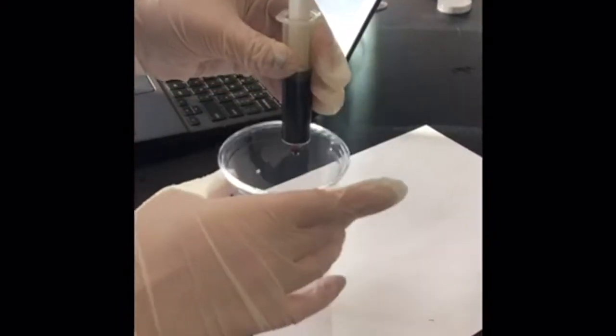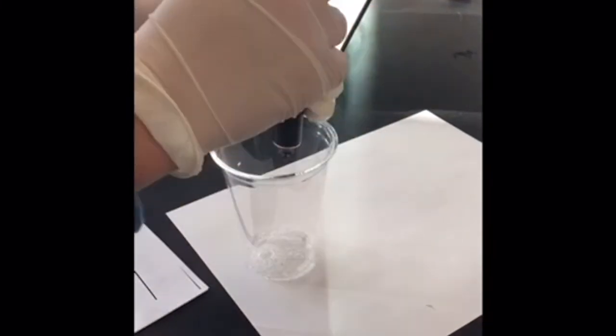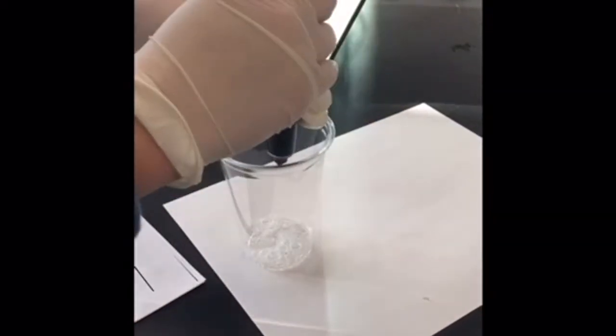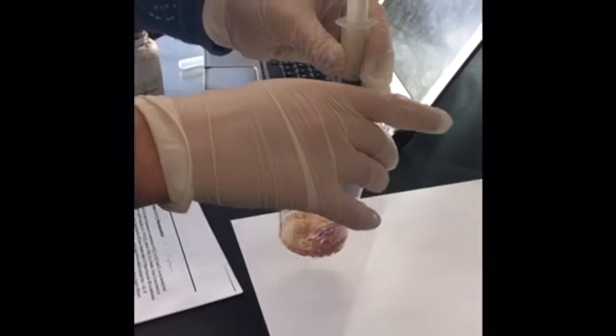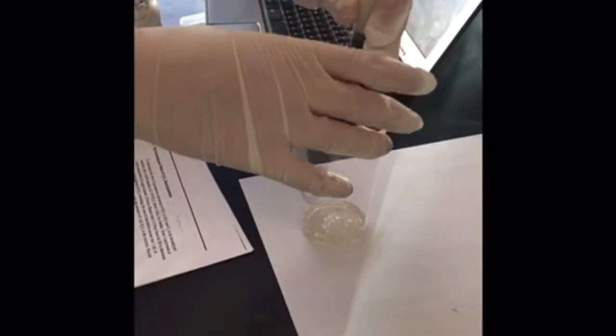We discovered that the amount of hydrogen peroxide spontaneously decomposed was 3 milliliters, and the percentage of hydrogen peroxide that was spontaneously decomposed in 24 hours was 14.29%. This means that since the hydrogen peroxide was left overnight, the rate of the uncatalyzed reaction was 14.29%. We can then use that percentage to compare the reaction rate of hydrogen peroxide without an enzyme to the reaction rate of hydrogen peroxide with an enzyme.